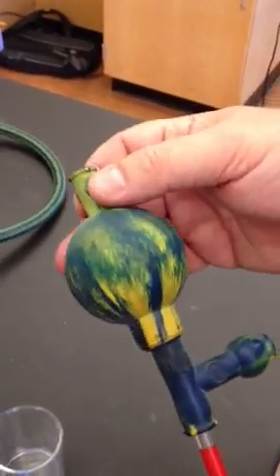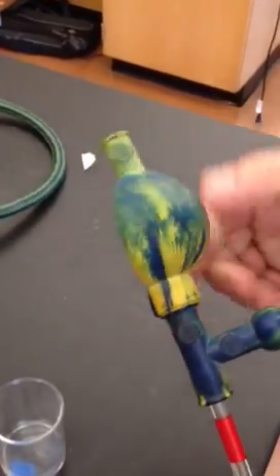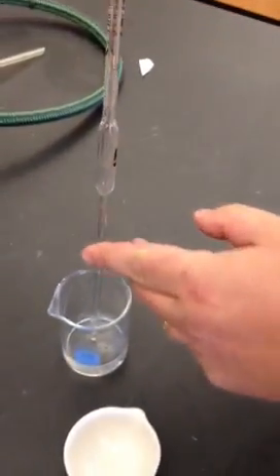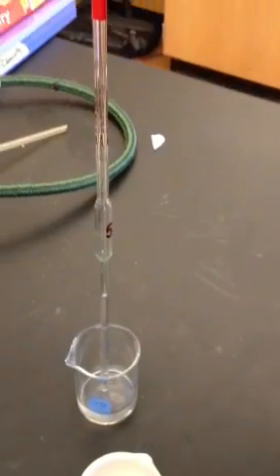On the bulb itself, the first thing you need to do is hit the A to let the air out. Then we're going to use the S to suck up the liquid. As I push the S, you'll see the liquid climb in.